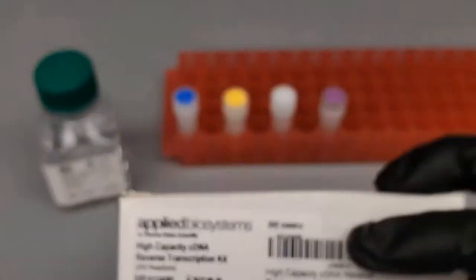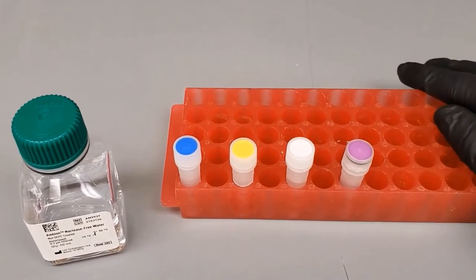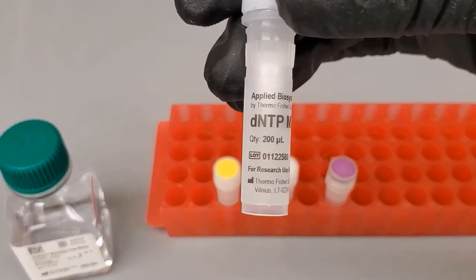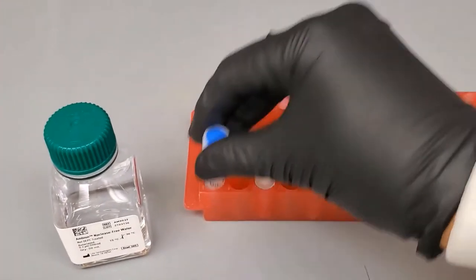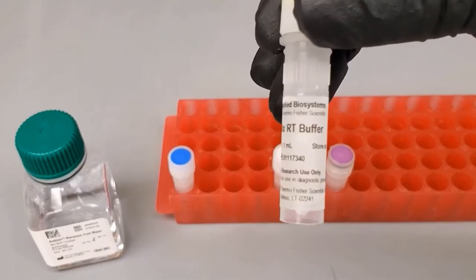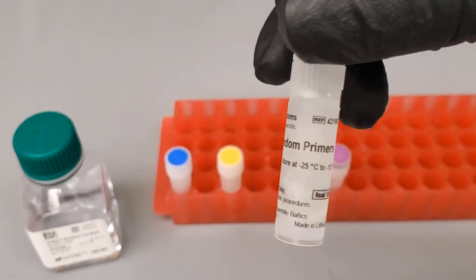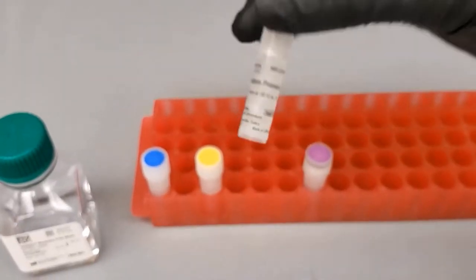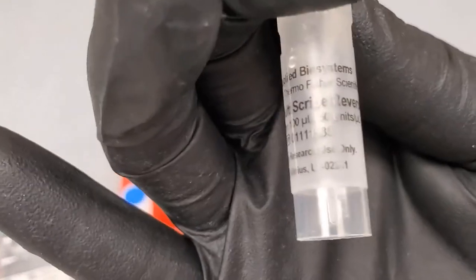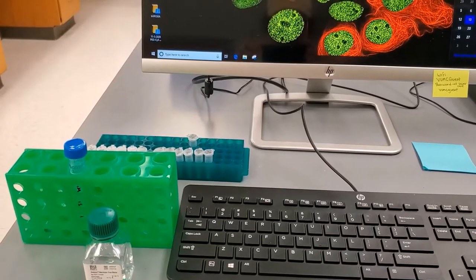This kit comes with four color-coded components. In blue we have our dNTP mix. In yellow we have our 10x RT buffer. In white we have our 10x RT random primers. And then what makes this reaction possible is our enzyme — the MultiScribe Reverse Transcriptase.